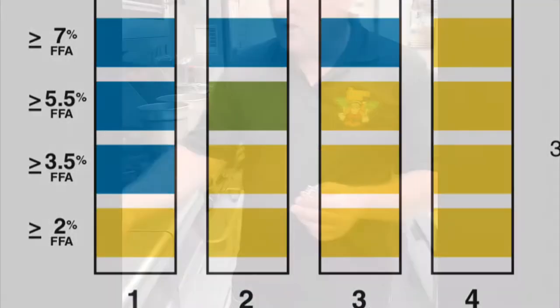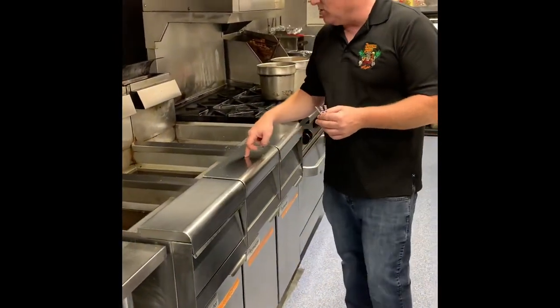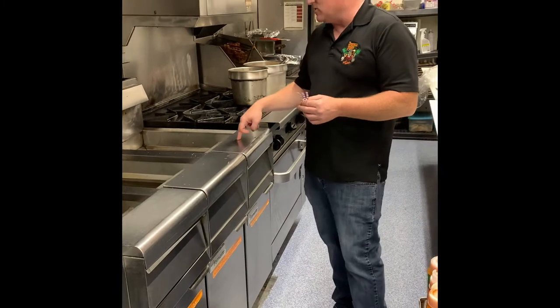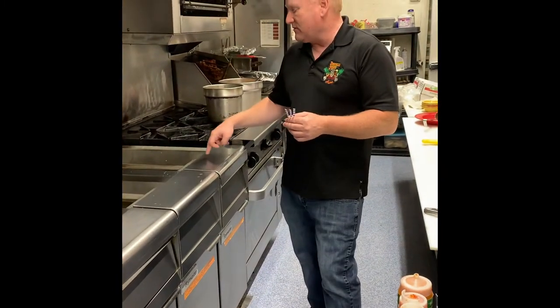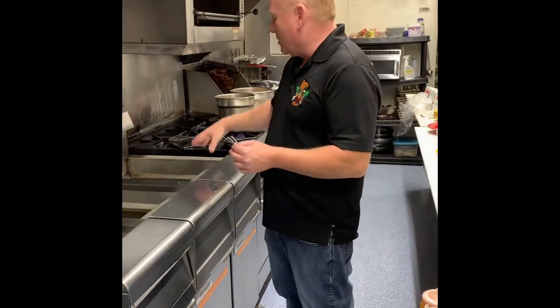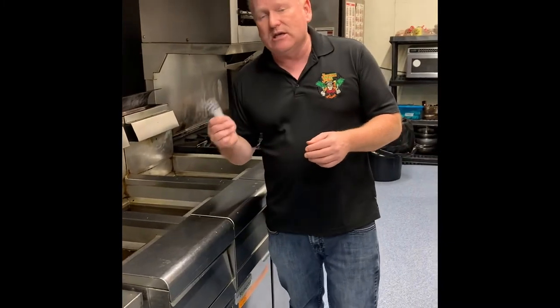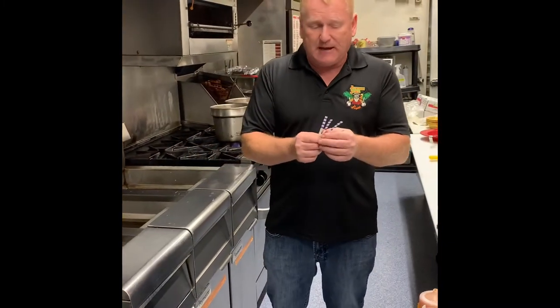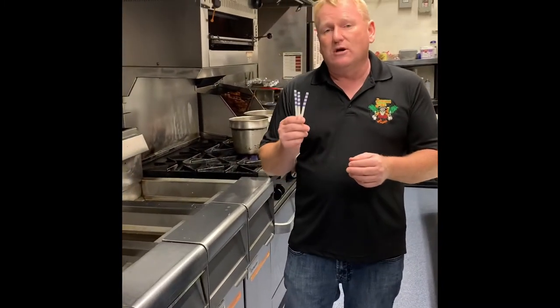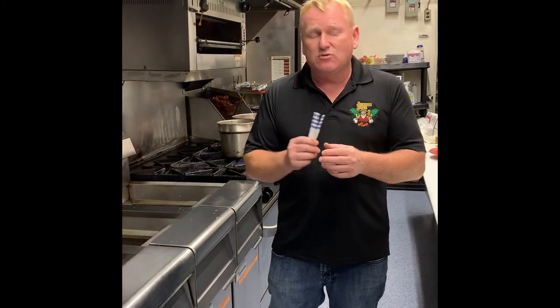This fryer here is one day old, this one is three days old, and this one is four days old. You'll see there will be more yellow in the older fryers. This is a great scientific method to see if your oil is spent — it takes out the guesswork and ultimately saves you money.